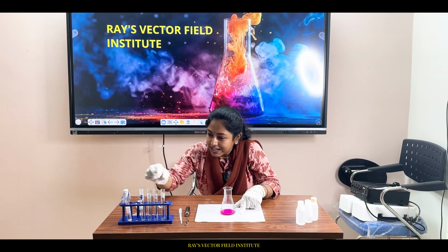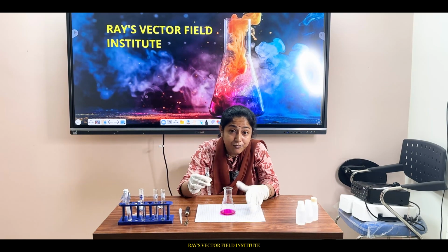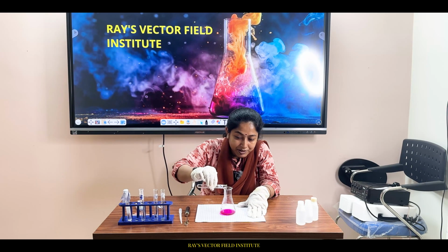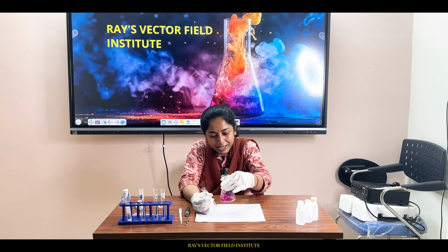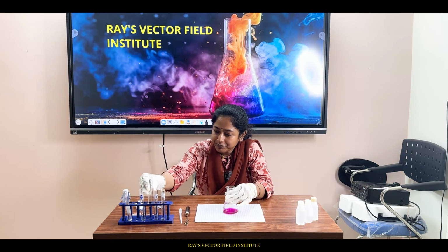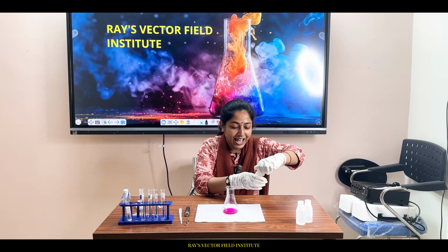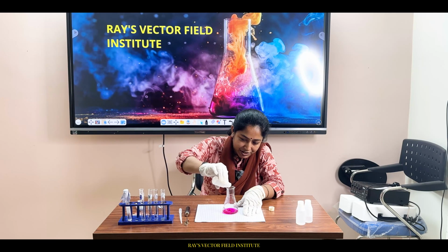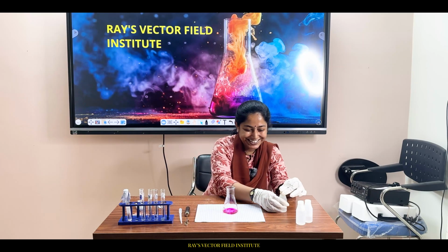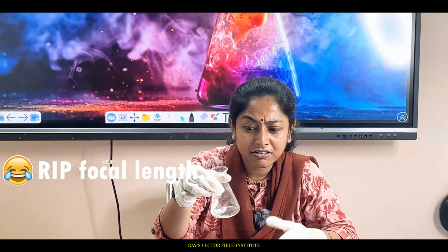Another suspense, let's add X sample a little bit more. Let's see what happens. In the beginning of this drama, I already said that we will be playing a game with chemicals. Let me add this chemical from its stock. Stay tuned with me, do not go anywhere. Oh my God! Color gone? Why? What happened?